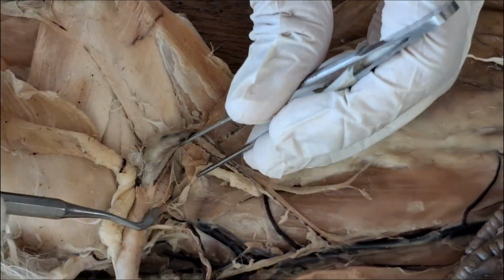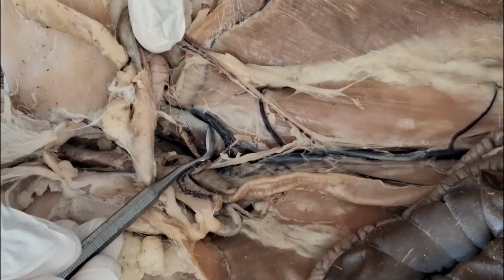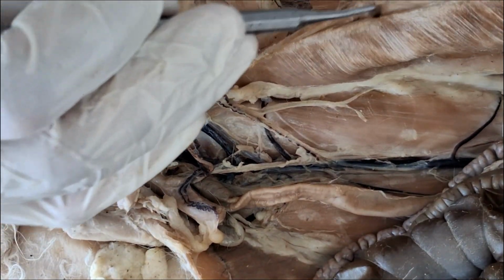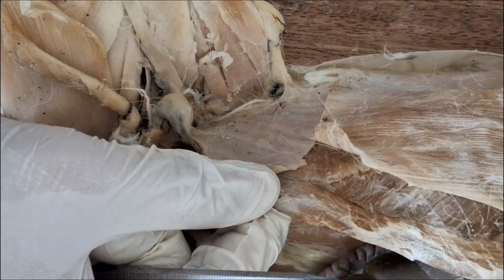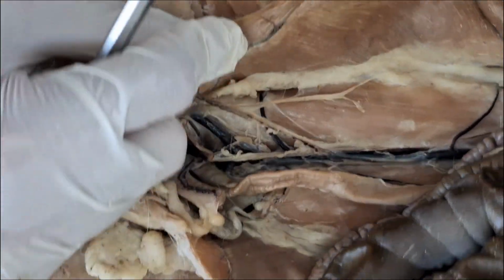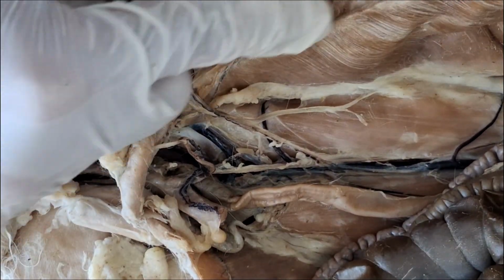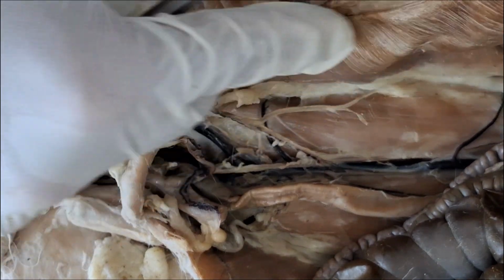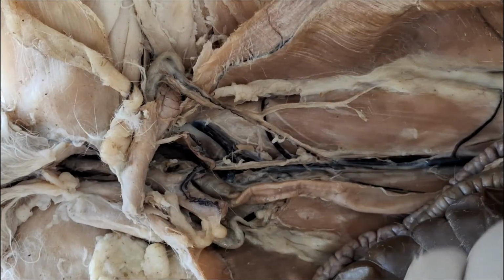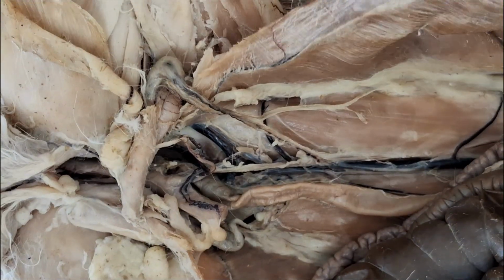What are the tributaries of the external iliac? First, external iliac. There's a tributary crawling underneath the obliques or the transverse abdominal muscle. So whatever that vein is that crawls underneath the body wall is the inferior epigastric vein. Remember, there's a superior epigastric all the way from the internal mammary.